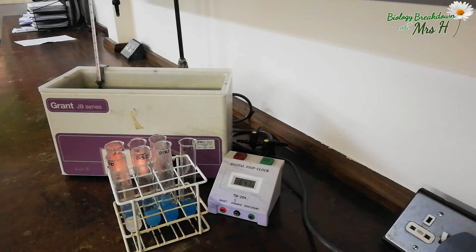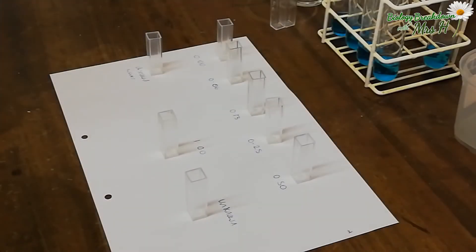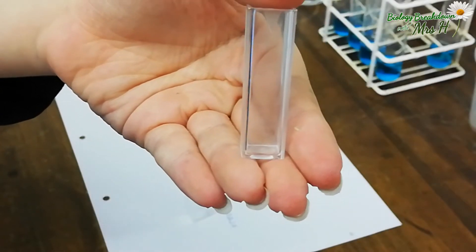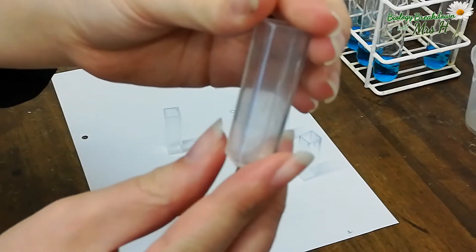On this piece of paper you can see that I have placed eight cuvettes next to labels: the six concentrations and the unknown, and one cuvette for just distilled water with no Benedict's reagent. Notice that the cuvette has two clearer sides and two translucent sides.